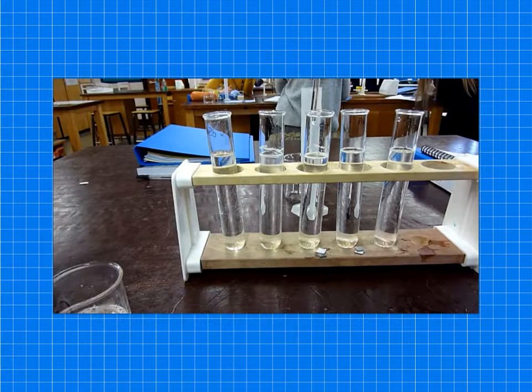This next one, I think this is 40%. And you can see again, they put the card down the bottom, and then you can see there's a slower rate of reaction going on there.